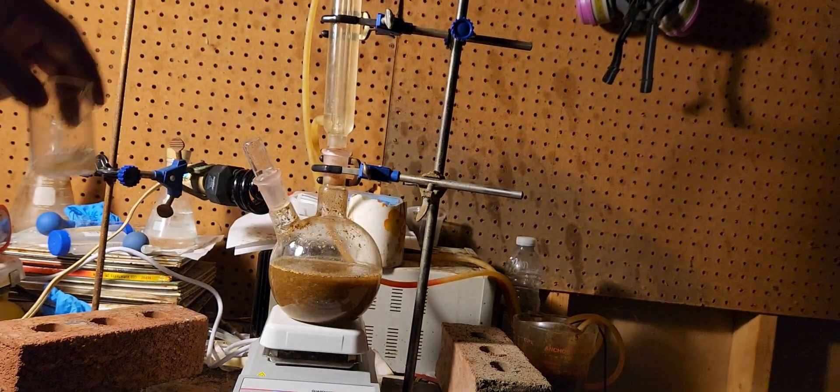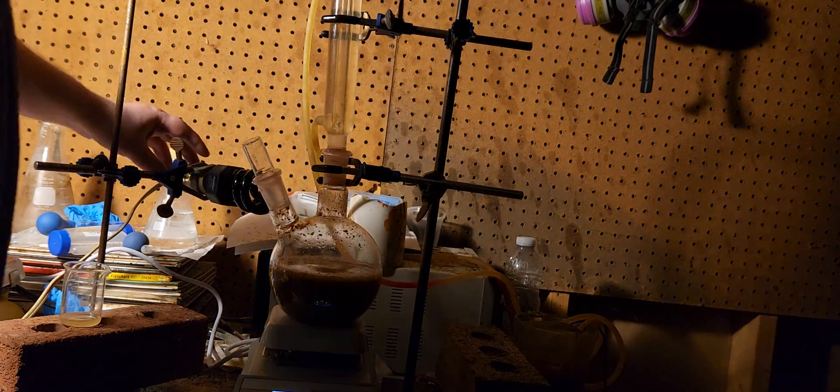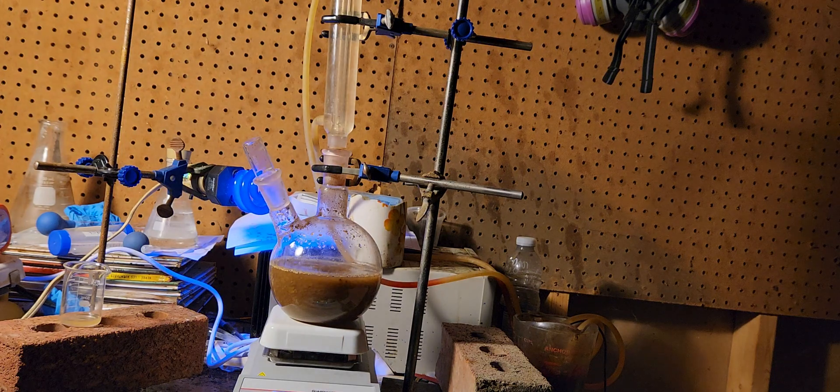I extracted it and put a little bit of vinegar or acetic acid 10%, so I'm going to turn on this light. Everything turns purple or blue. Then I'm going to put this up to solution.